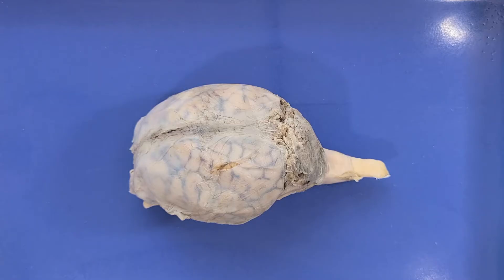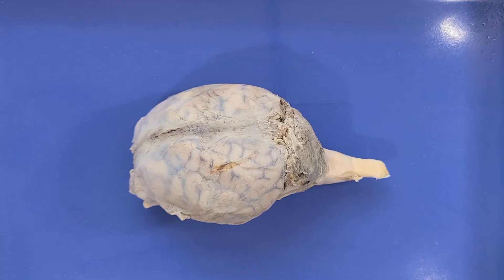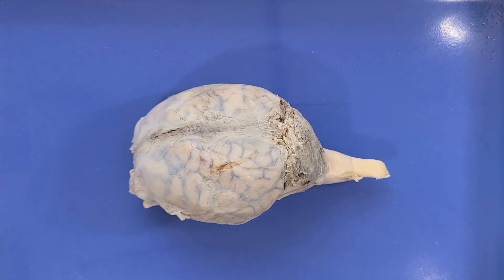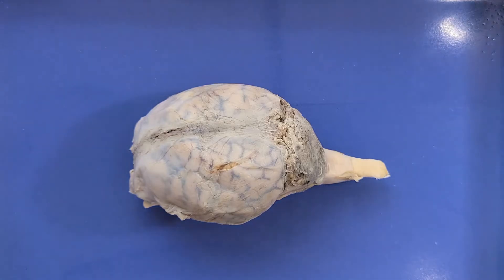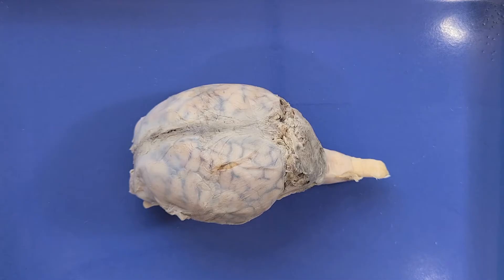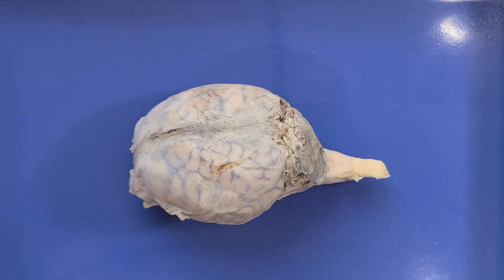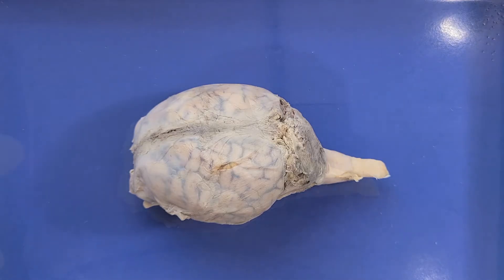Of course, this is a sheep brain, not a human brain, so there are some differences. The most obvious being size. The human brain is much larger than this — the sheep brain is pretty small compared to us.